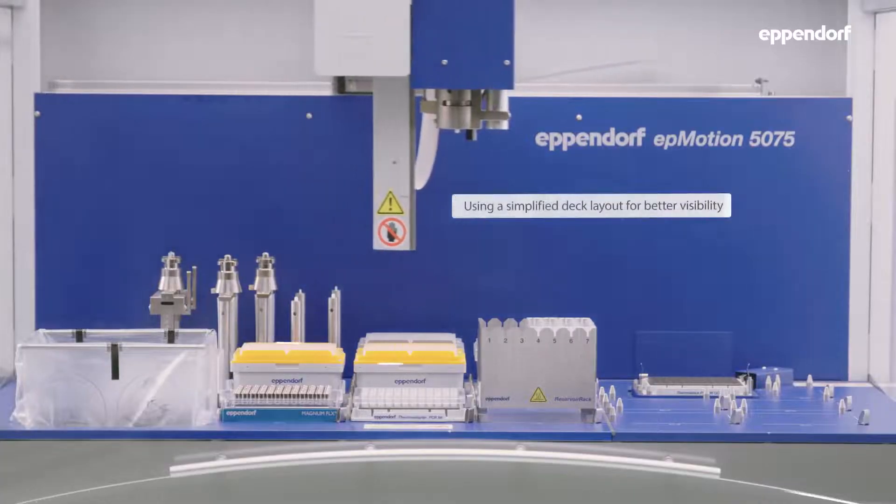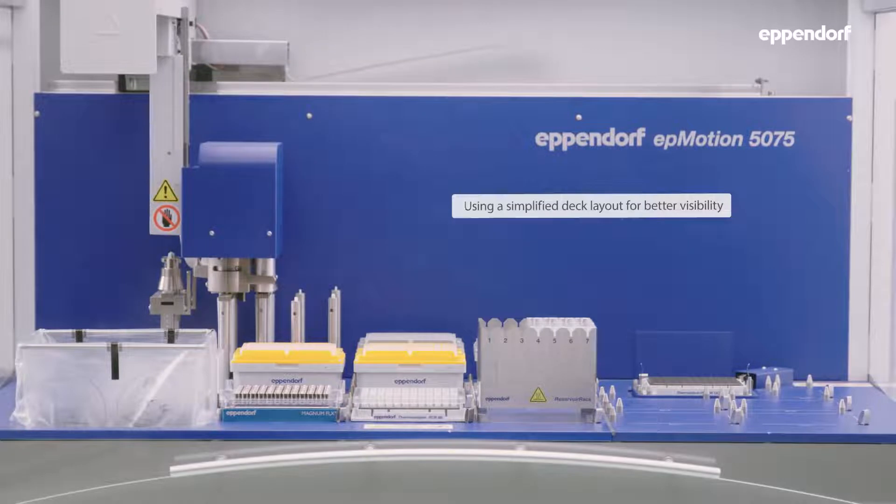The EP-Motion automatically detects if the volumes of beads and buffers are sufficient to perform the method.